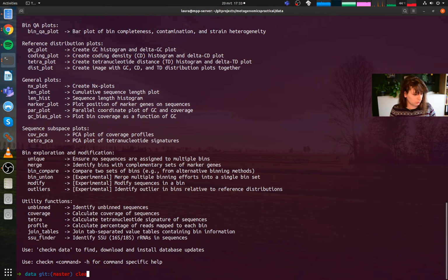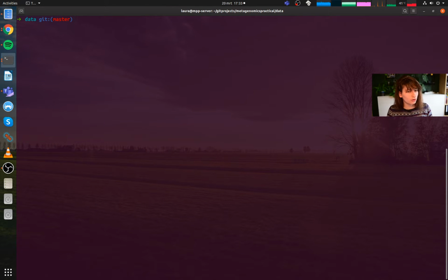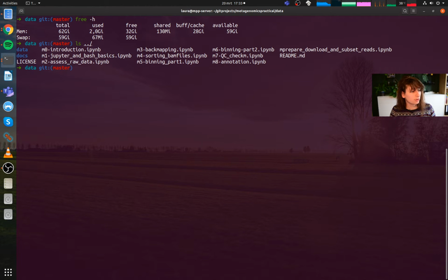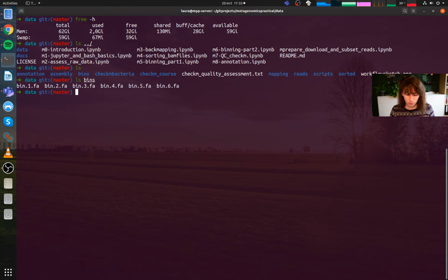Okay, so let's just clear this up. I'm now on a server somewhere on the Uithof, Utrecht University. And this server actually has a lot of RAM. So actually 62, so that's plenty. We can do our 34 gigs CheckM calculation on there. So I'm in the folder for the course. I have pretty much the same files as you have, plus some extra. And I also have my bins folder, just like you have. And now I'm gonna run CheckM.